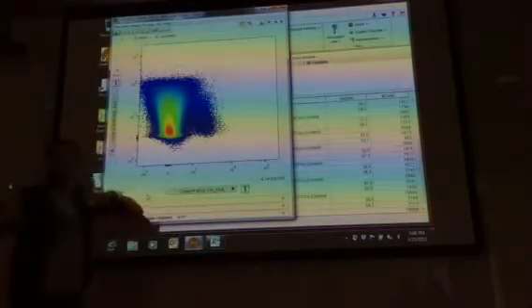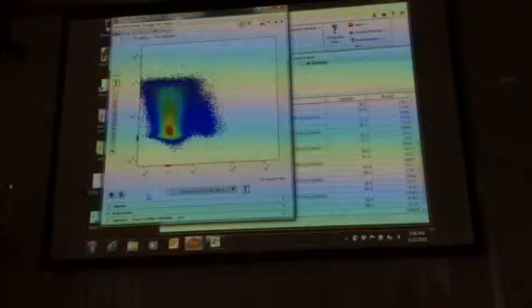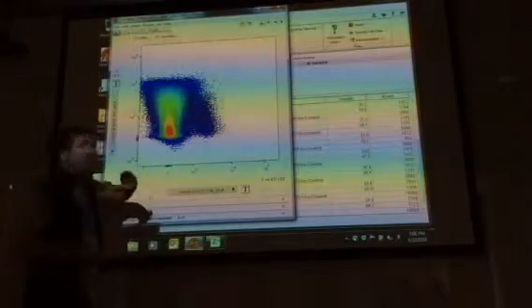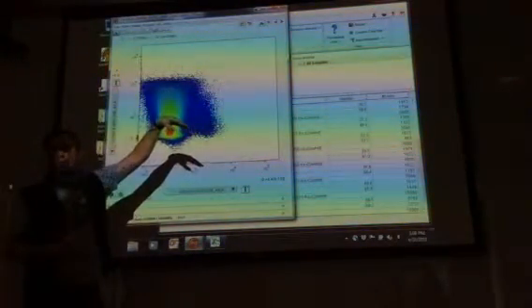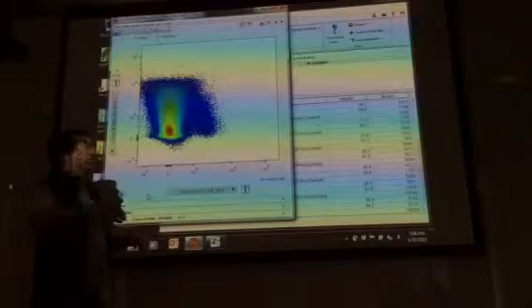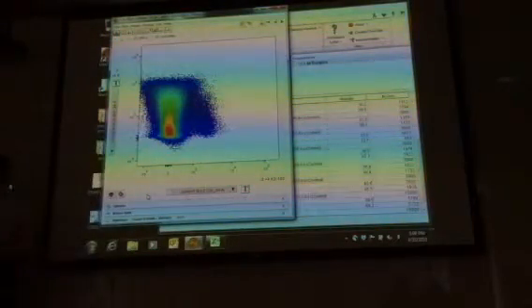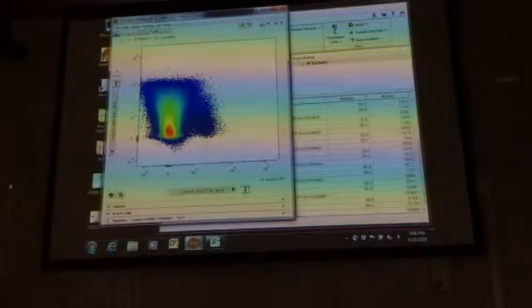But what you would need to do is go back to single stained controls, things like unstained controls, to see whether or not that's the case. But then where do you actually draw the CD38 cutoff as well? Again, that involves going back to the unstained controls, looking at where the profile exists, and then trying to draw the gates off of that.